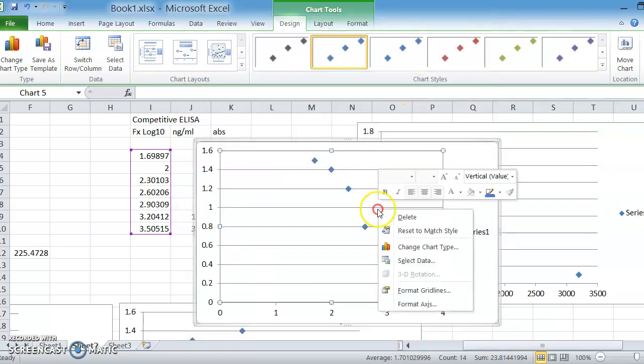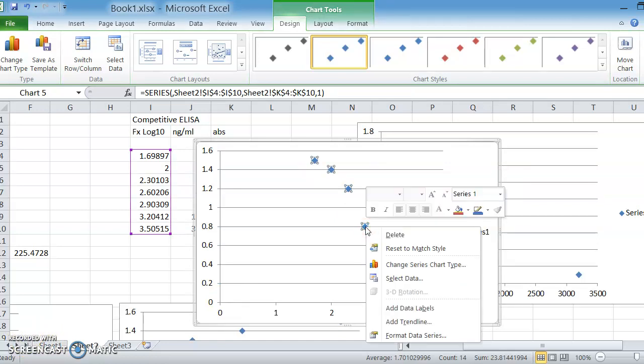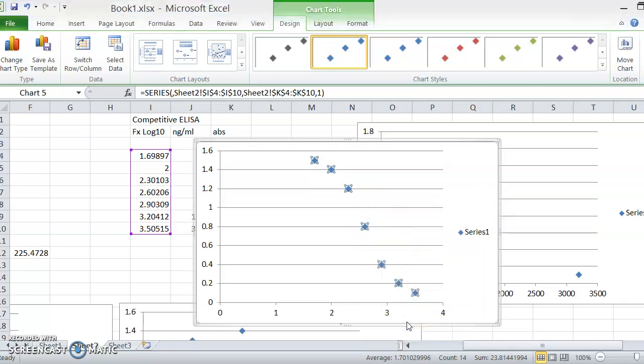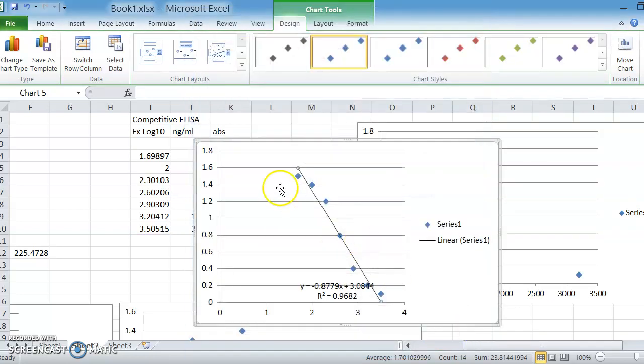not like that. Click on the data point, right click on it, and do your add trend line. Just like before, set equation on the chart, show the R squared on the chart, and then you've got your line, and you can plot your competitive ELISA data in exactly the same way. Just basically do exactly what we did for the non-competitive ELISA, but do this for the competitive ELISA.